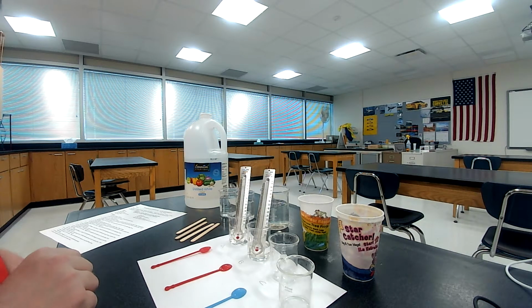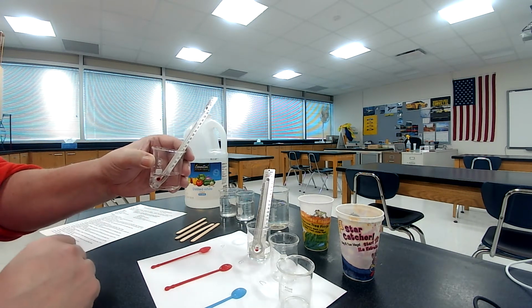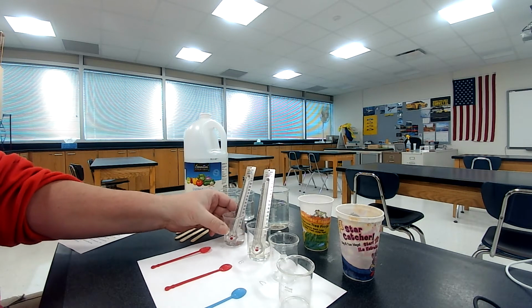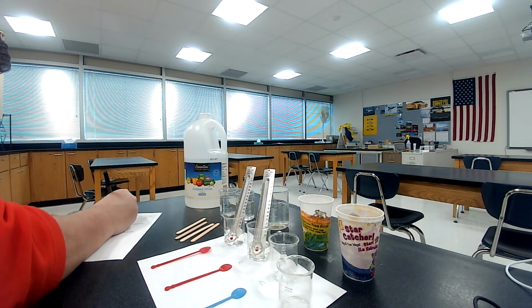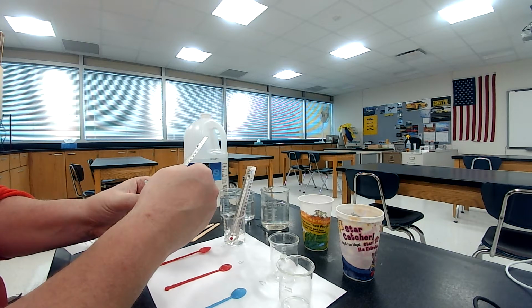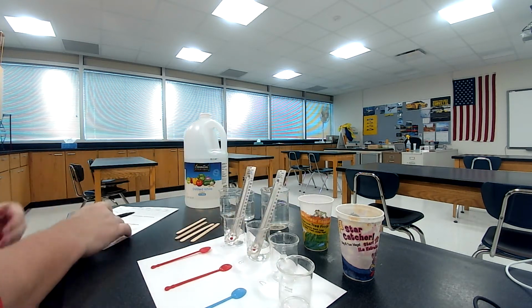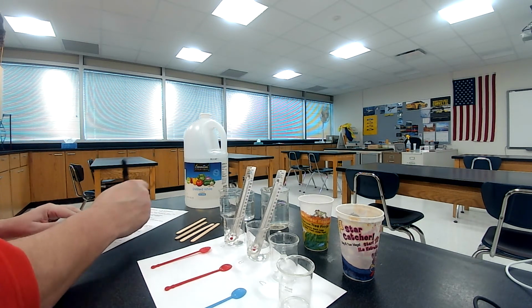All right. So I'm going to look at A right here. And A, we're going to do this in degrees Celsius. A is reading about, looks to be about 19 degrees Celsius for A. So you'll want to record that in there for A. Initial temperature, 19 degrees Celsius. And B, this one could be a little bit off with the thermometer, but it's reading 22 degrees Celsius for B. Okay, so we got that done.